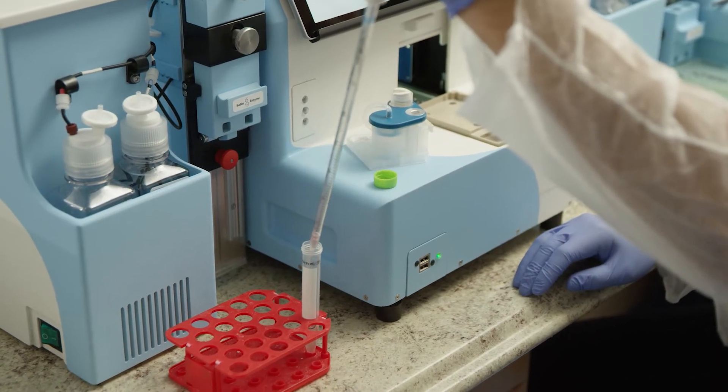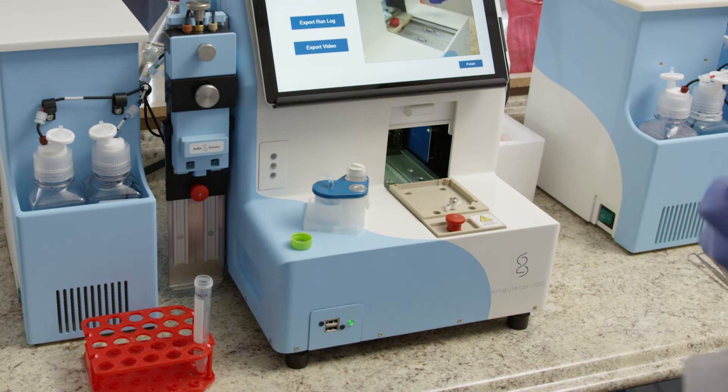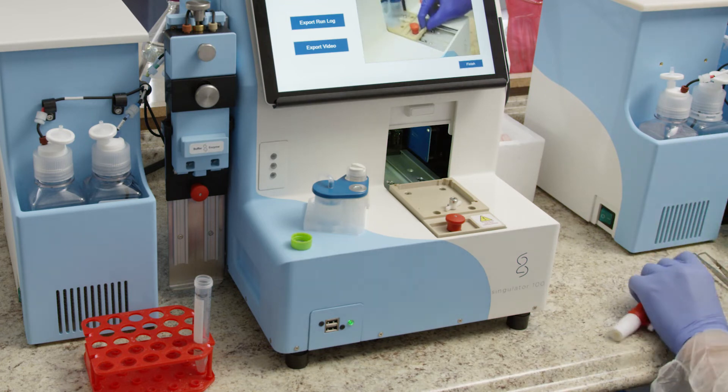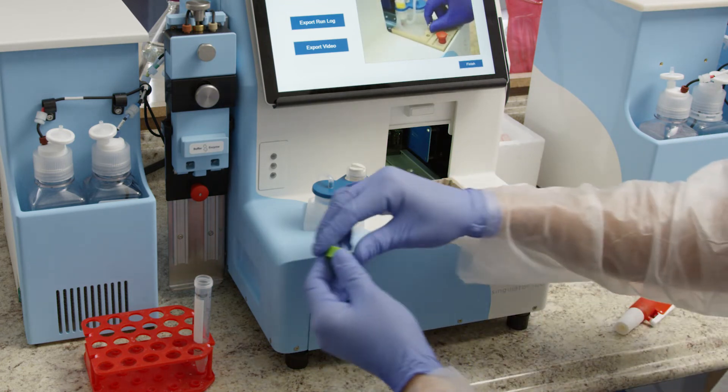The final volume of the suspension will vary depending on the protocol options. A standard isolation protocol will yield 3 to 3.5 milliliters.